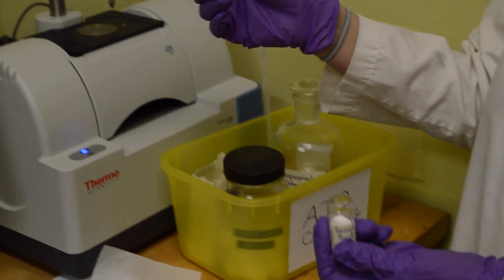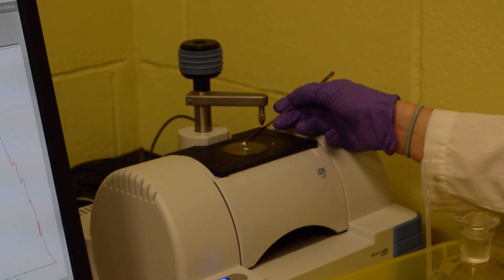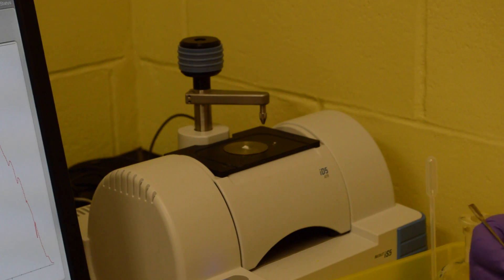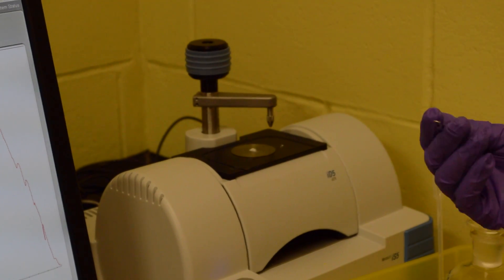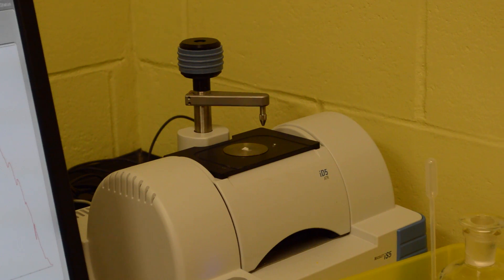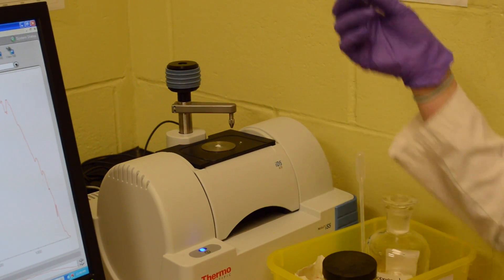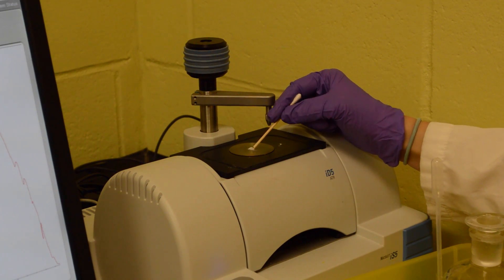We want to put that on the crystal. There's a crystal right in the middle of the metal disc. You want to make sure to be very careful and not to scratch any of that equipment with the spatula. Use something a bit more dull to gather all of the solid to the center crystal, like the edge of a Q-tip.